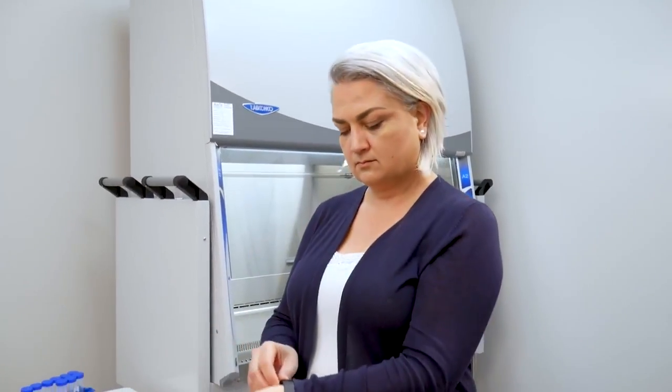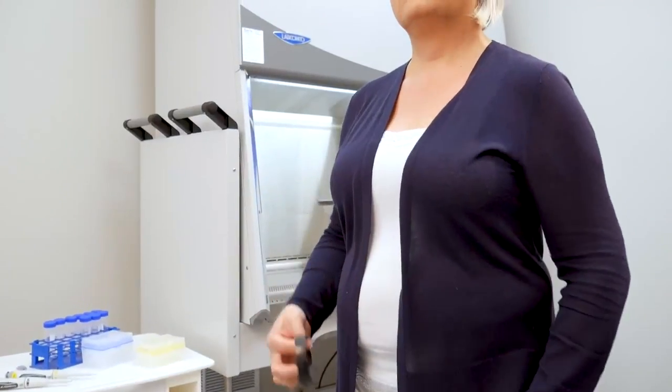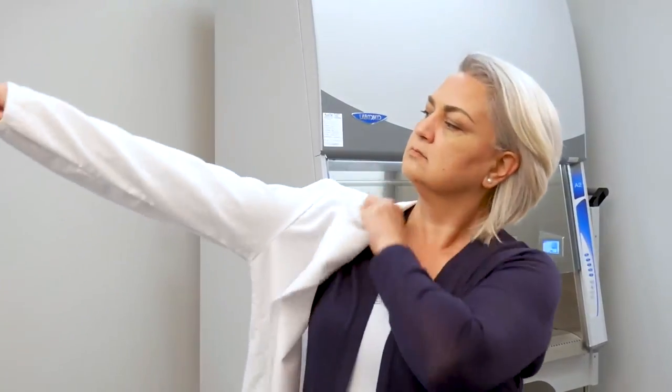Before starting work, secure any loose garments and long hair and remove any jewelry that may interfere with safe operation of the BSC. Next, don appropriate personal protective equipment, PPE.